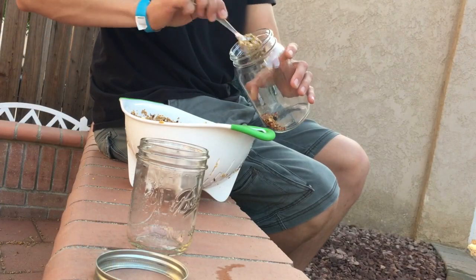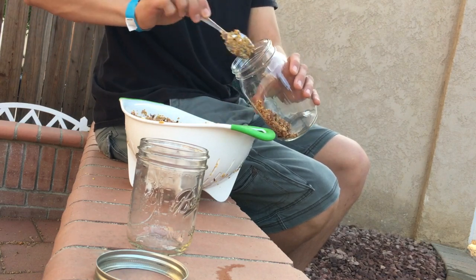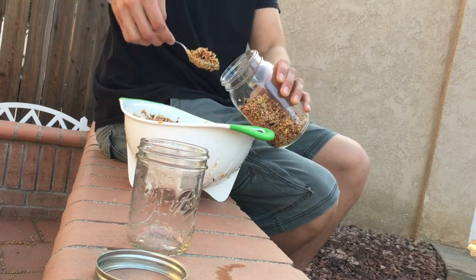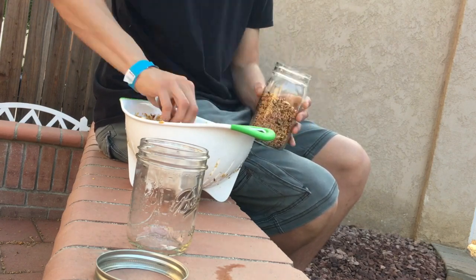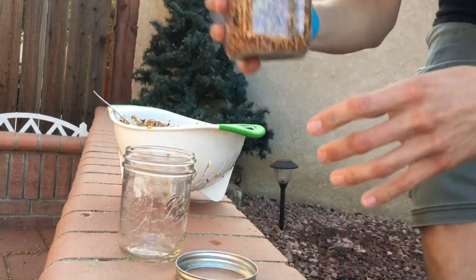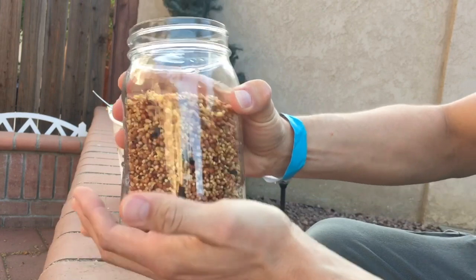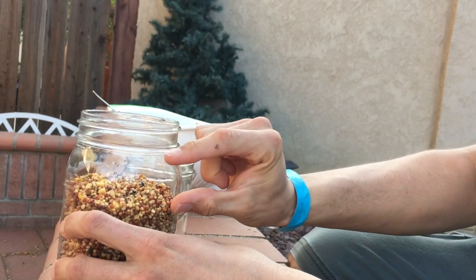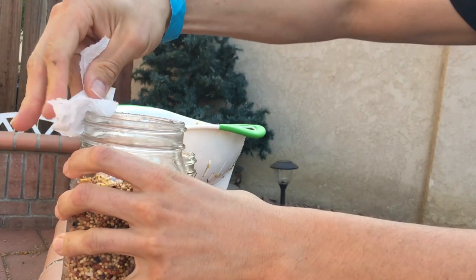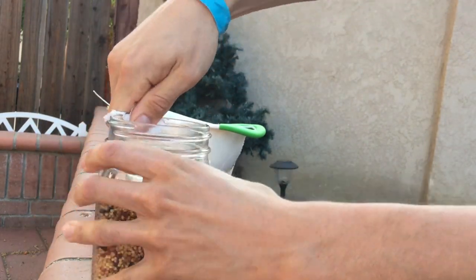To load your jars, just tilt and use a spoon and start scooping. I like to fill my jars to about this level so that once the jar is somewhat colonized, I can shake and have room for the grains to move around freely. Once that's done, wipe away any debris and water that could be on the top of the jar.